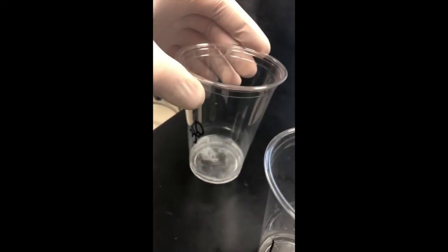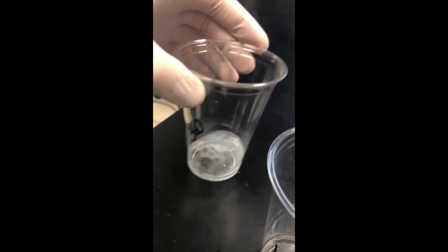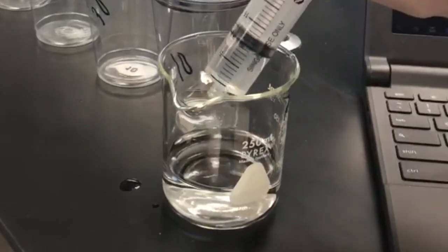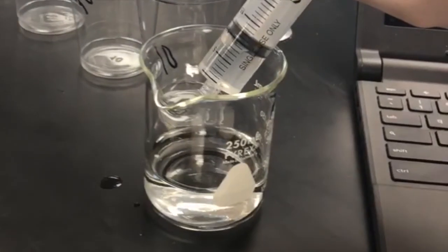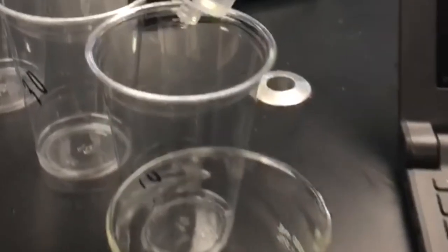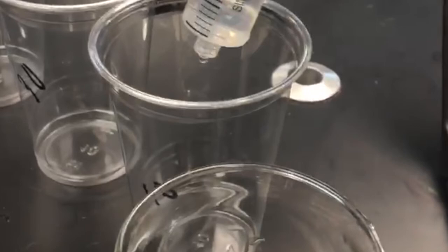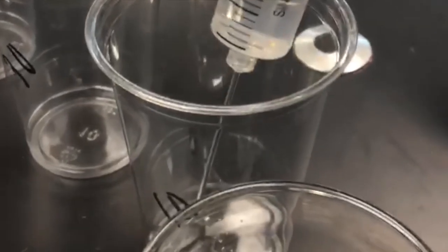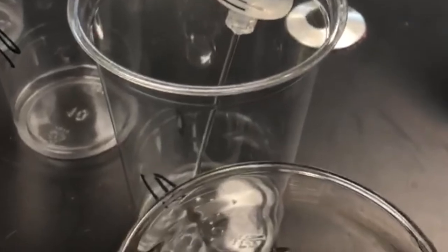Ways to improve the validity of the experiment include making careful measurements and determining where the plunger seal ends, especially when measuring dark-colored substances such as KMnO4, using a new syringe for each sample that is being collected, and subtracting the final amount of KMnO4 in the syringe from the initial amount in order to determine how much was required to titrate each sample.